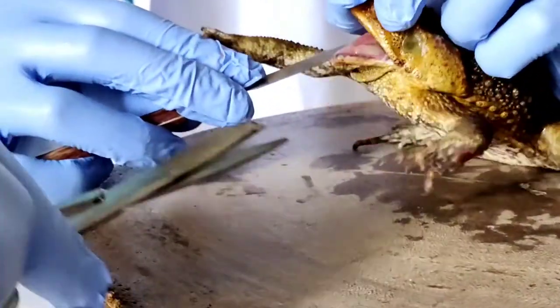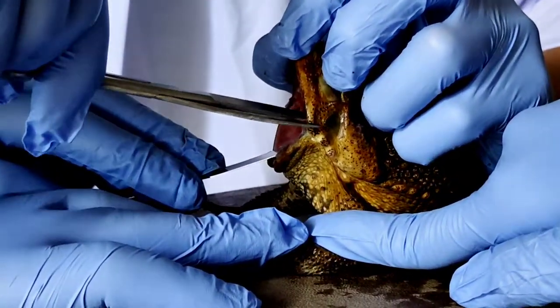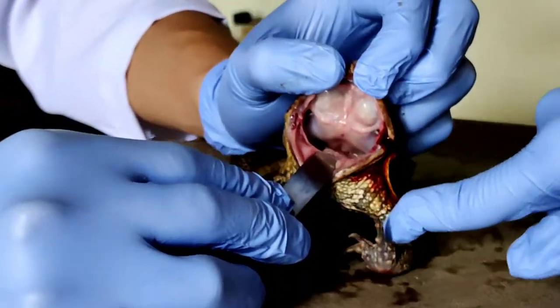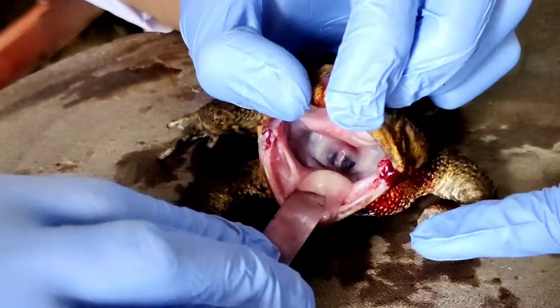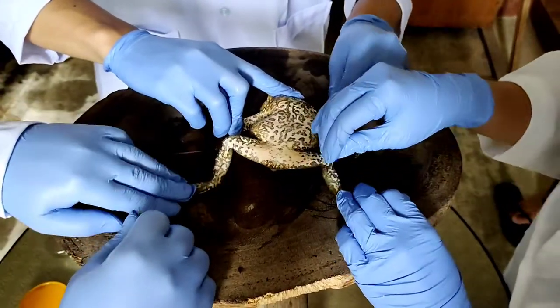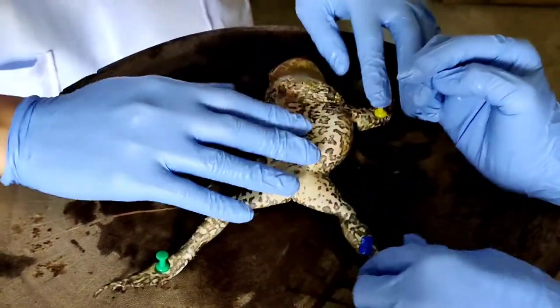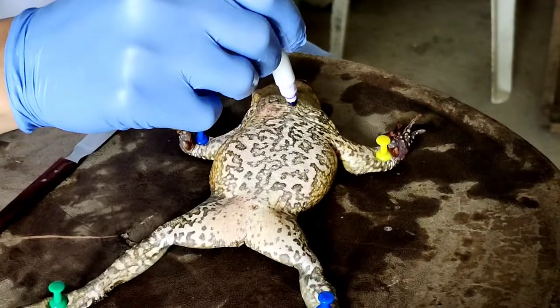We positioned the frog onto a hard surface so it cannot escape. We used the wooden surface instead of a dissecting pan. Using the marker, we drew incision lines to help as a guide for our cuts.